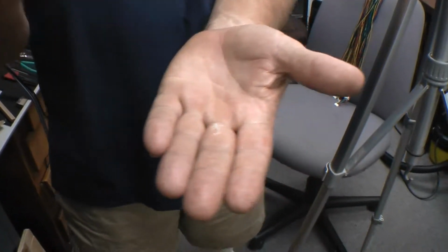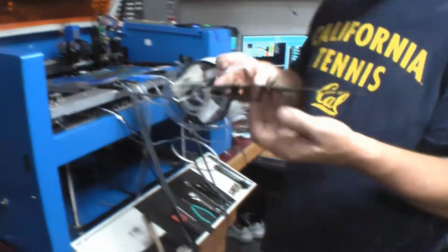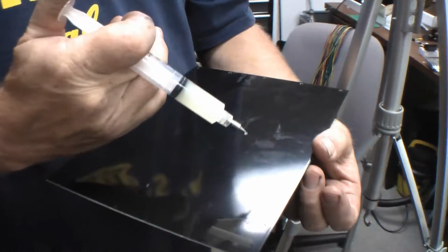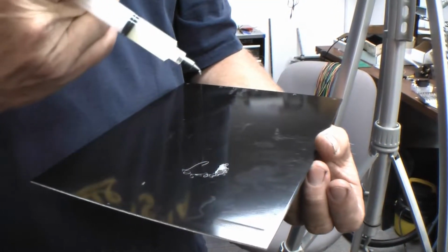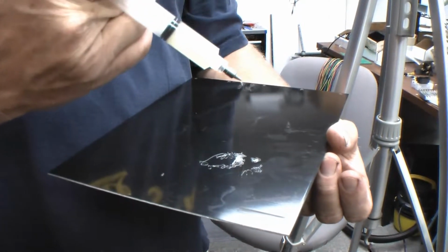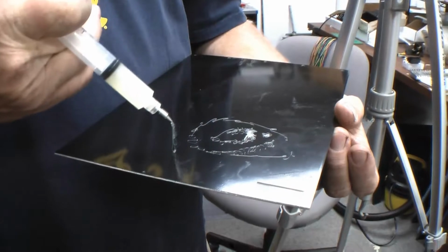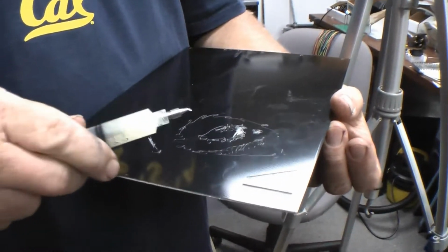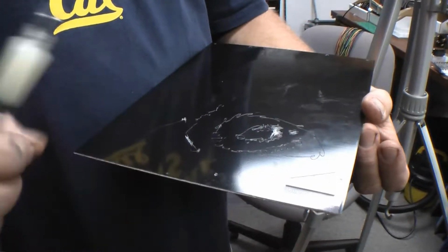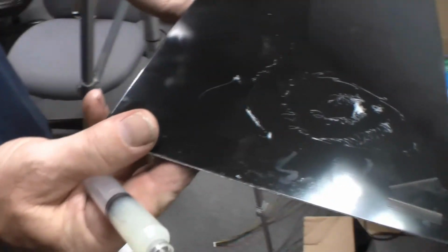hair that's coming out, and actually, can you see it on my hand? And you know what? Let me put it on some black paper. Against your blue shirt, probably. I've got a black surface here. So, look at that. It almost looks like electrospinning the way it's coming out. Almost. Okay. Close up. You get the light reflecting it? Here, I'll bring it over where you can get the light on it.